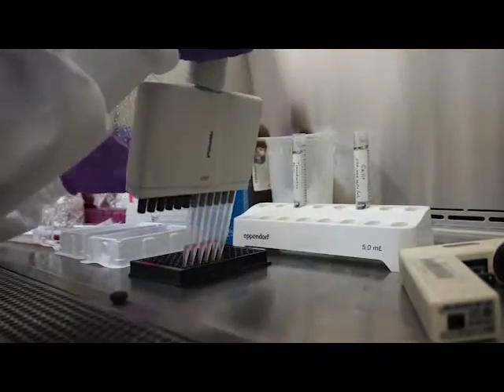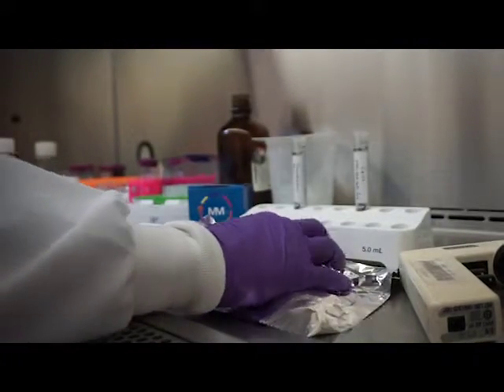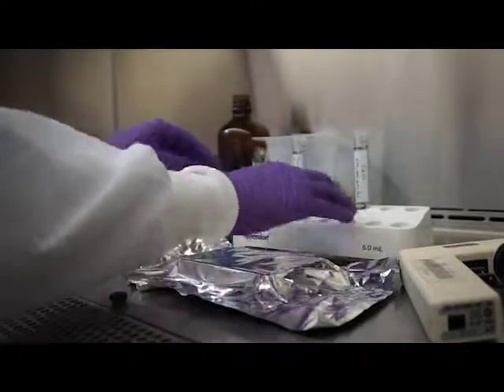After plating the complete transduction mix and cells-only control, we cover the plate and let it sit in the hood for 30 minutes. It is then placed in the incubator until the time of the experiment.